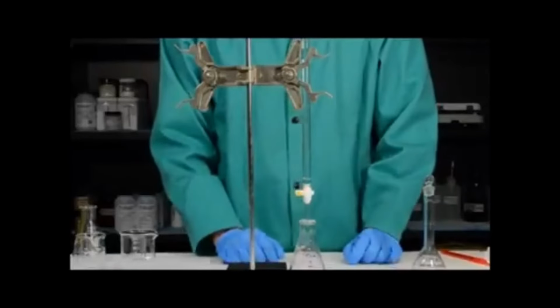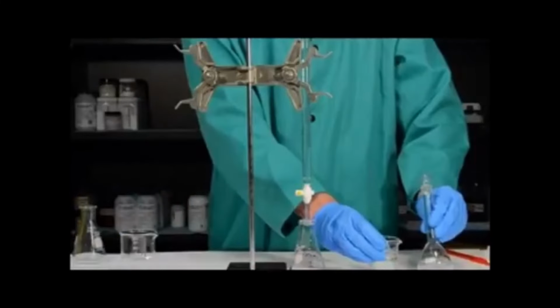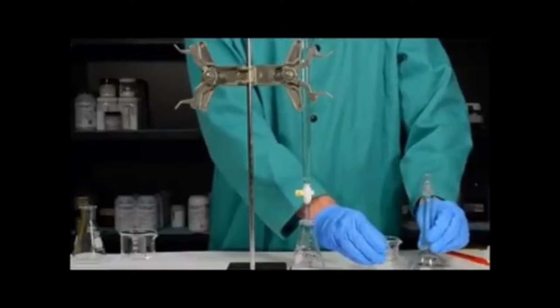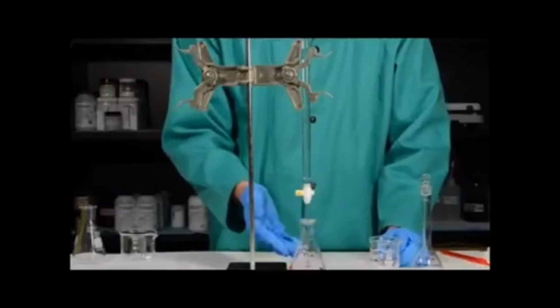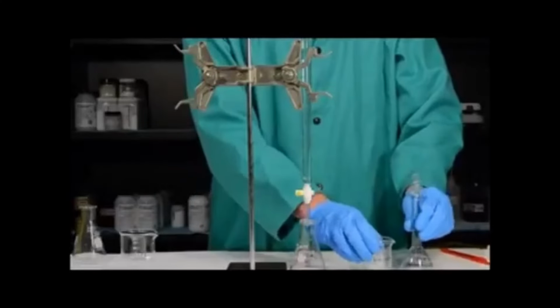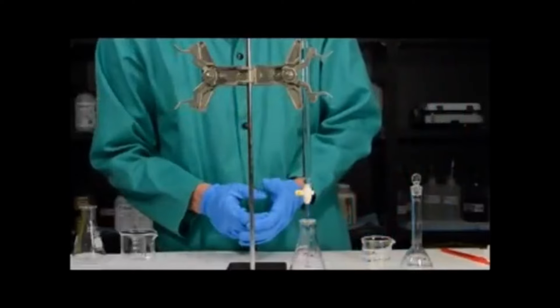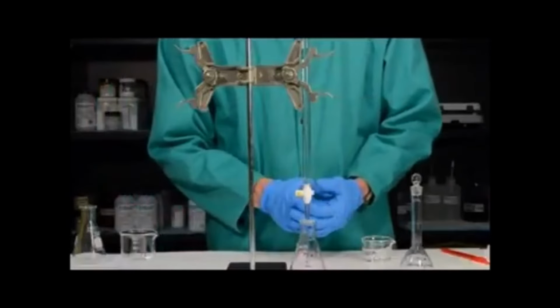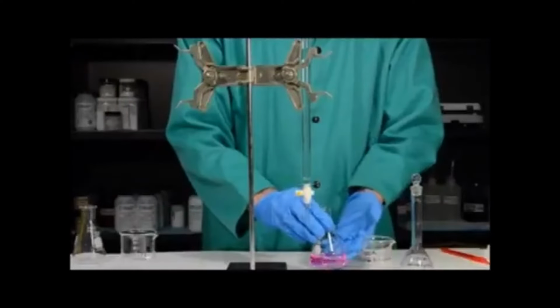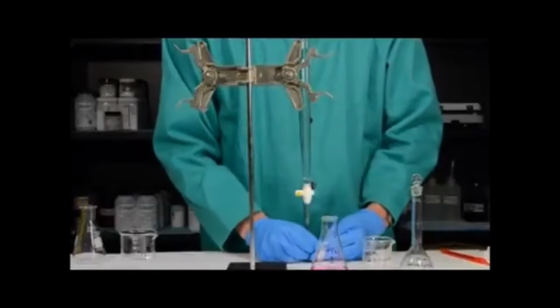Now that you have completed the titration and have the initial and the final burette reading, it's time to clean up. We have designed this experiment so that the concentration and volume of the sodium hydroxide and hydrochloric acid solutions will exactly neutralize each other. So you should mix all your waste from your 4 titrations, we only did 1 here as an example, and all your leftover solutions into 1 container. You will then have approximately 0.2 molar sodium chloride or salt water. This solution can go down the sink. Although it may look a pink color, there is almost no phenolphthalein indicator, as it is very dilute in these solutions.